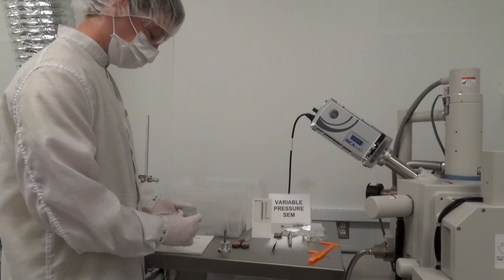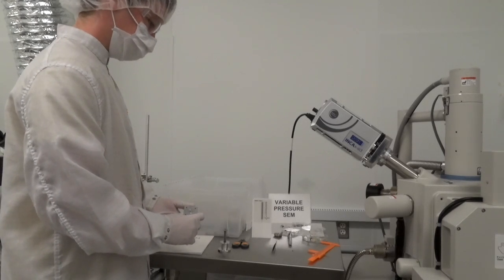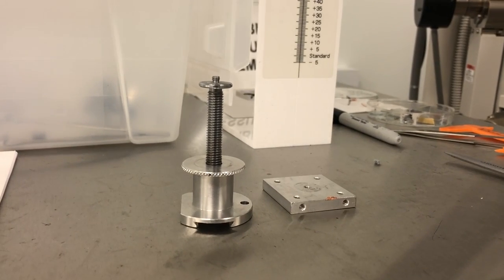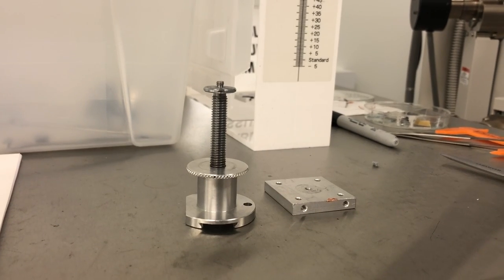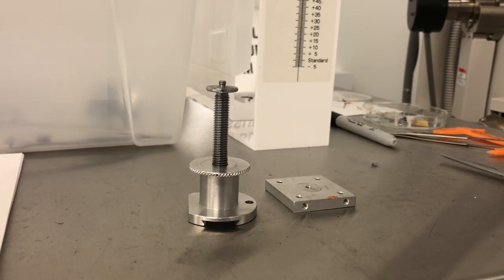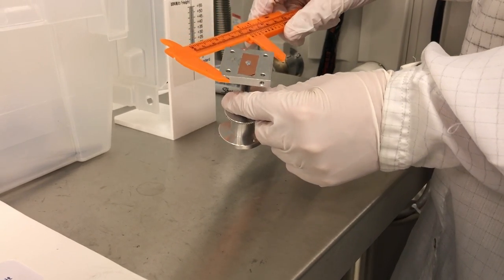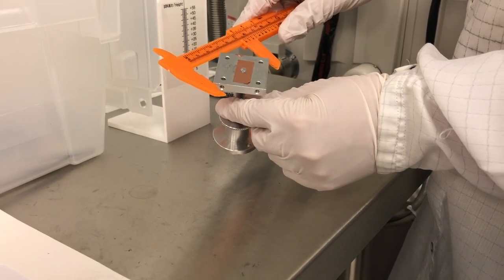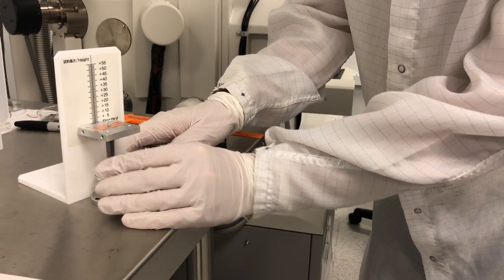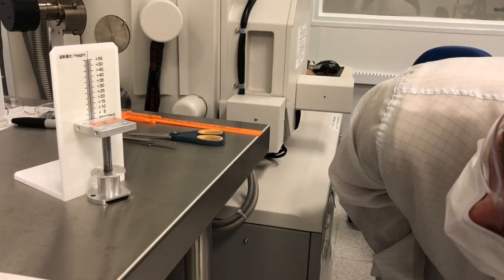If you require special characteristics or desire your own mount, it is your responsibility to have a machine shop prepare one that has the correct dimensions to fit the holder. The sample's width dimensions should not be wider than the stage, and the sample's height dimensions should not exceed 55mm when compared to the height gauge.